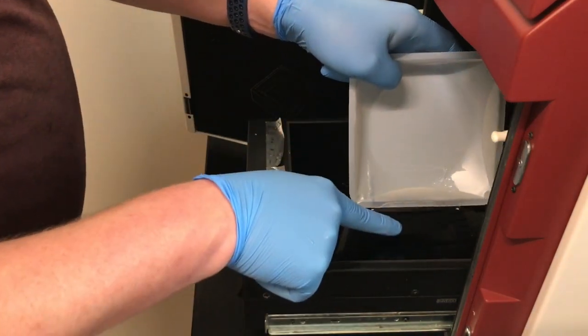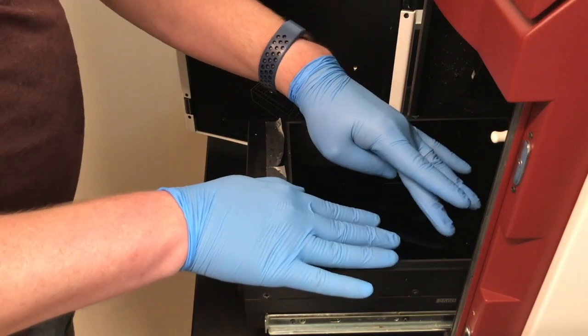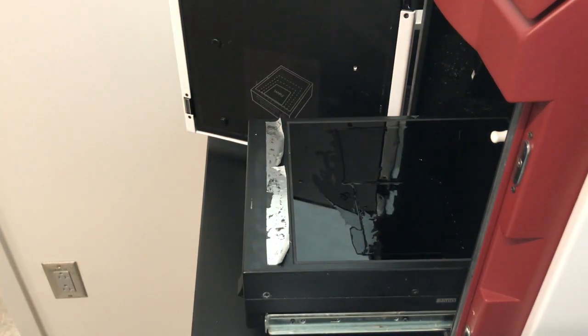I'm just ever so carefully sliding them into place and then putting them into the gel imager for the irradiation and imaging.